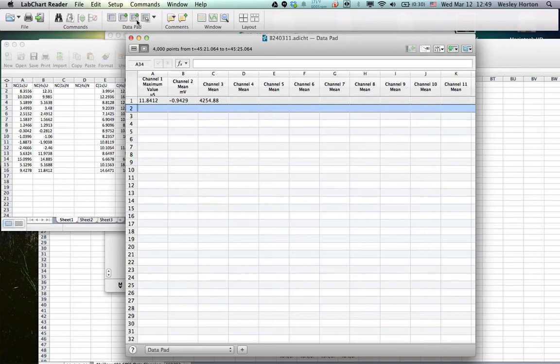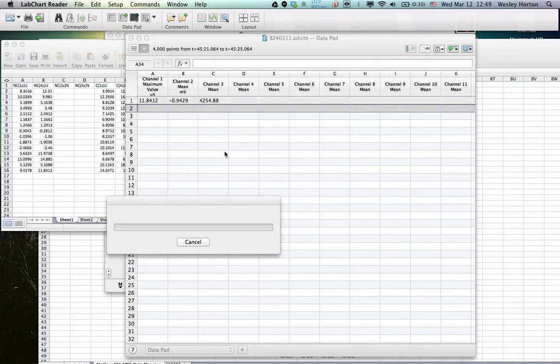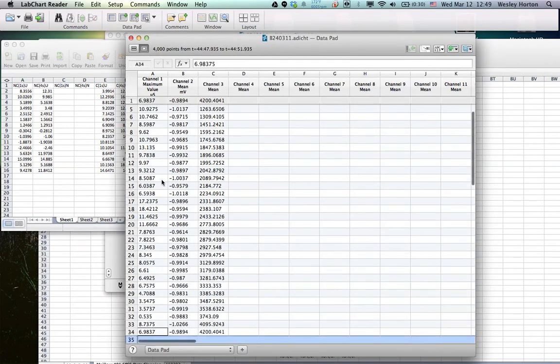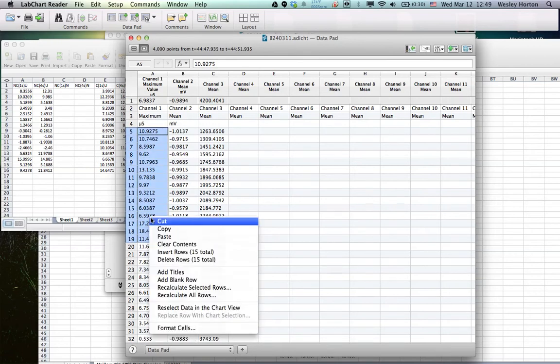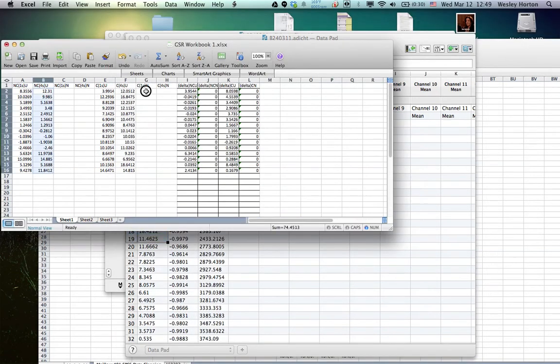Alright. We're going to do multiple add to data pad. So this is going to be maximum value again, so I'm going to put neutral for 4 seconds after. Alright, and I'm going to grab the data, first 15. Remember, this is the 4 seconds.